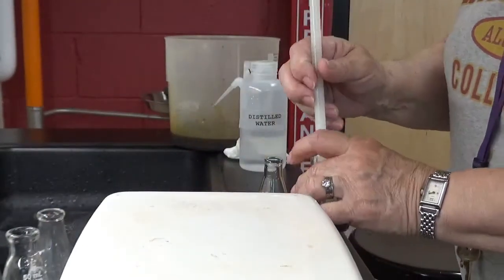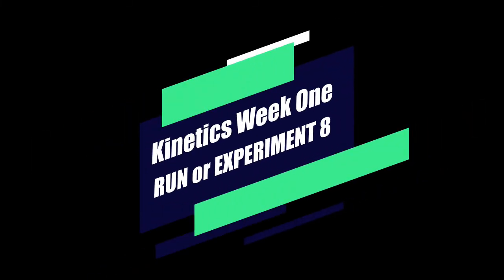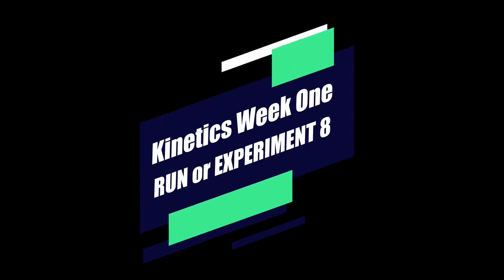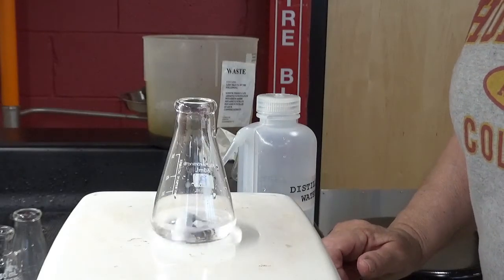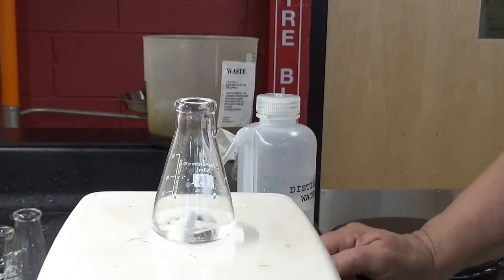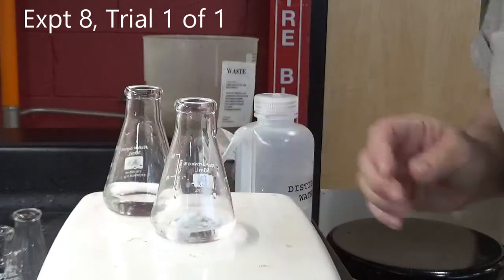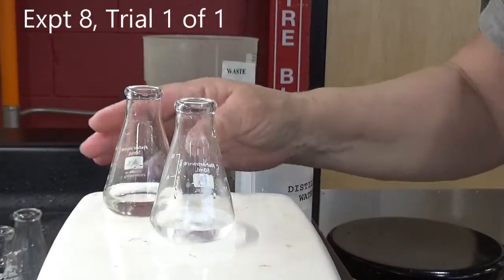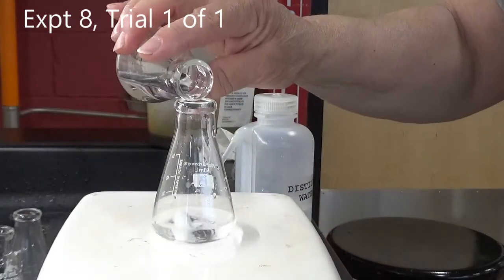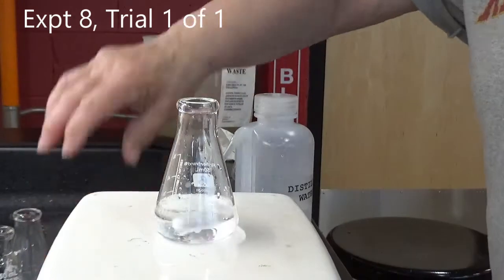Now we're going on to experiment number 8. We're going to try to do this once, because we're all tired of this, I'm sure. So here's my solution A and there's solution B. Let's add them together and see how long it takes. Pray.